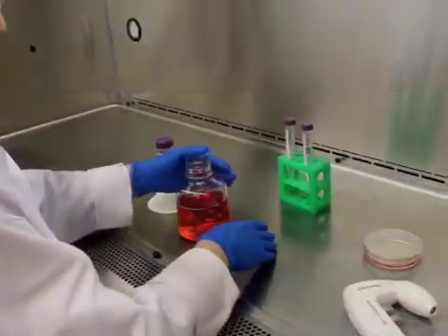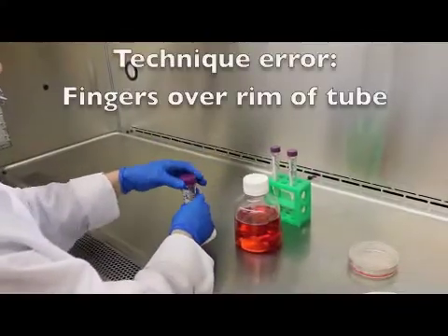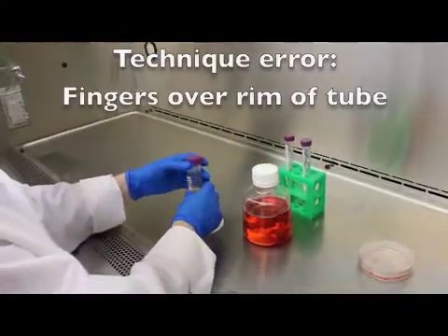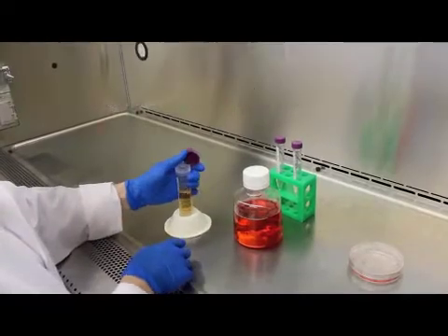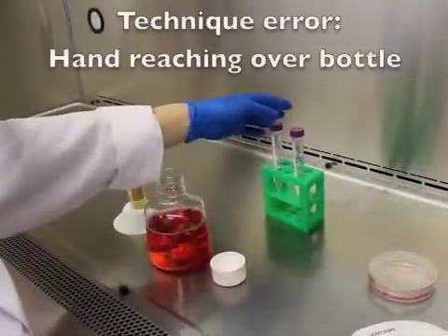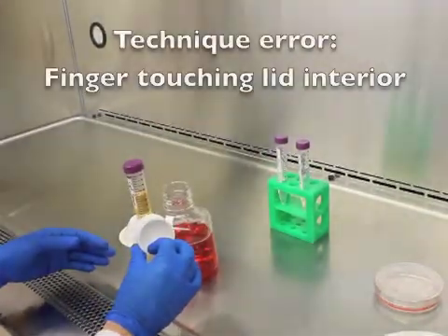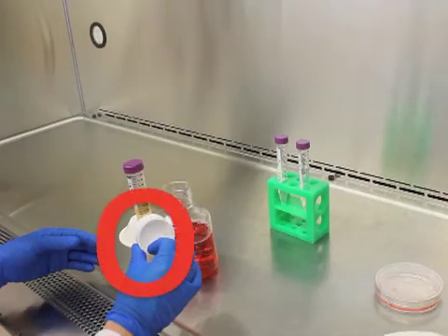You must learn to avoid touching the neck or rim of any container. You must learn never to reach across or above any open container. Avoid touching the rim or interior portion of any cap or lid.